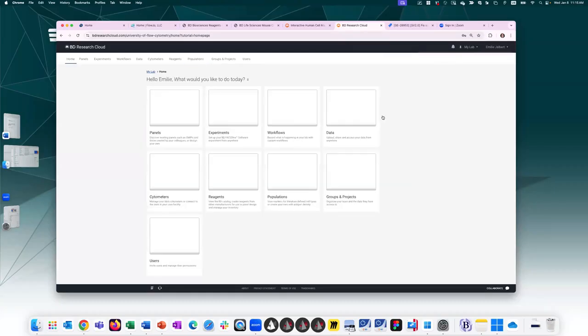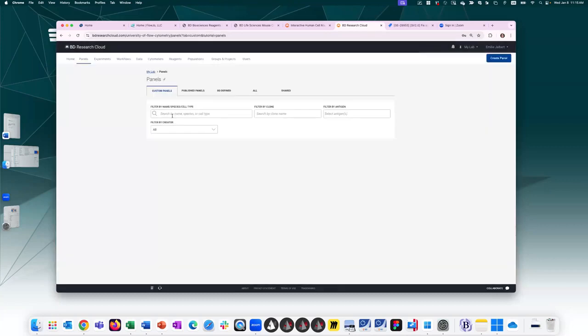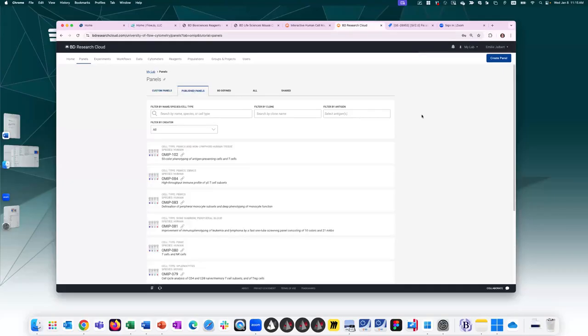So coming back to home, this time let's go ahead and click on the panel section. When in the panel section, you land on the custom panels tab. This shows all the previous panels that either I, yourself, or any of your lab mates have created. One tab over are published panels. BDRC comes preloaded with many OMIPs and other published panels.